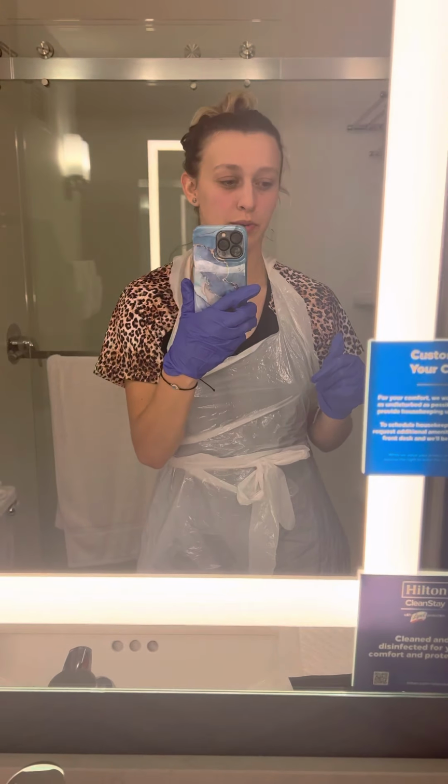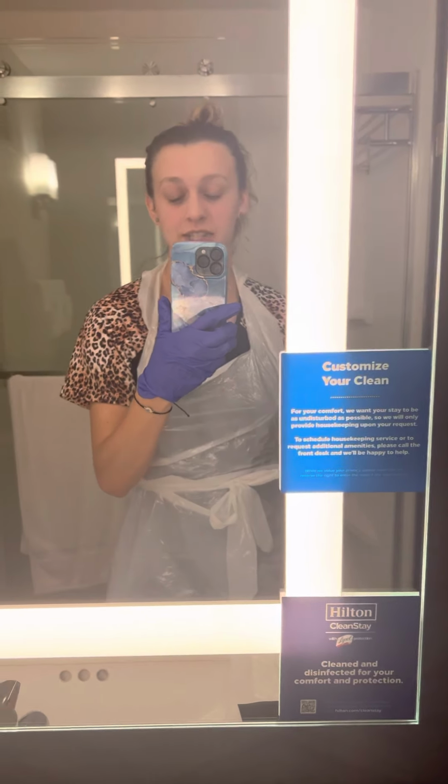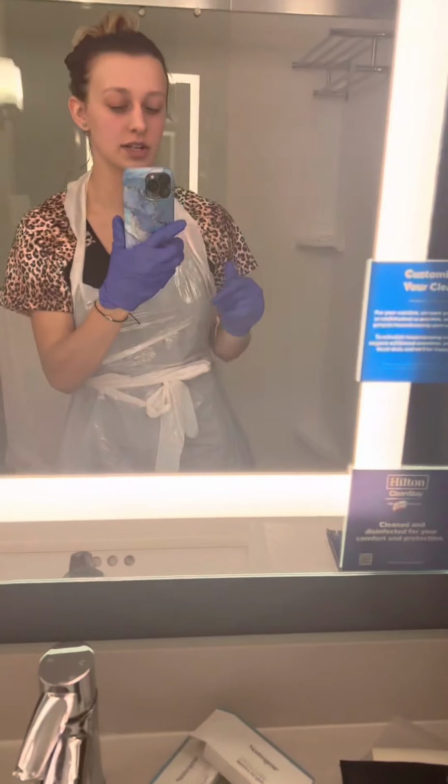This is Biology 201, Principles of Anatomy and Physiology, Lab 5, the sheep heart dissection.